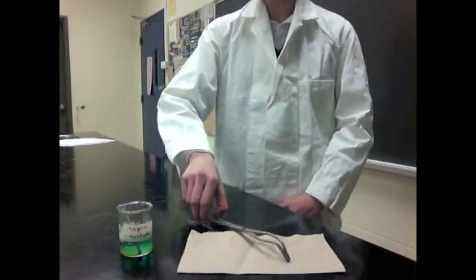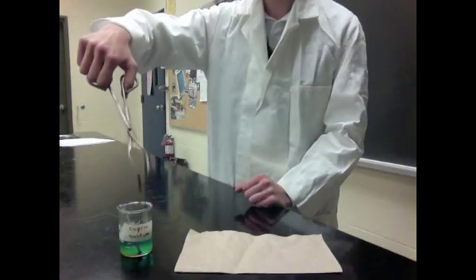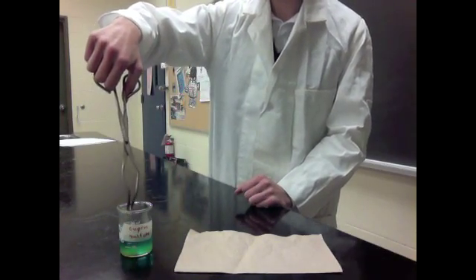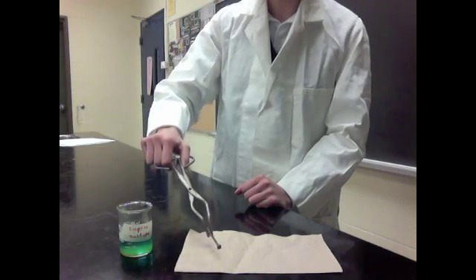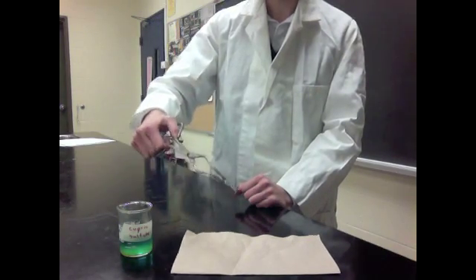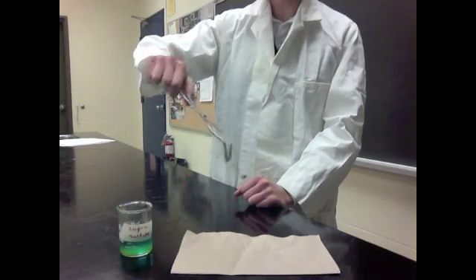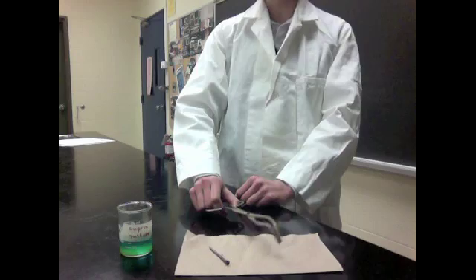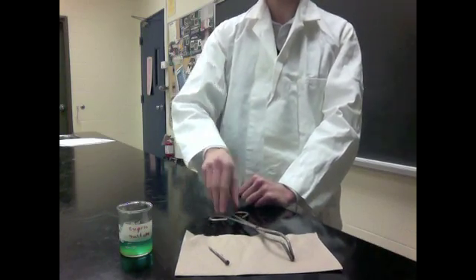Okay, now we are going to take the tongs and remove the nail from the beaker. What do you notice about the color? Jot down your observations onto your lab.